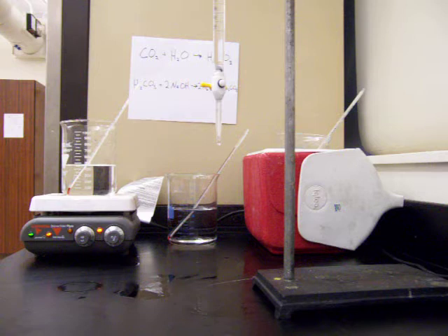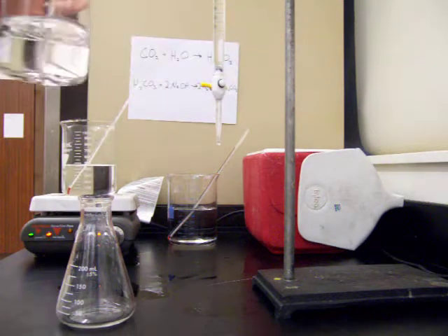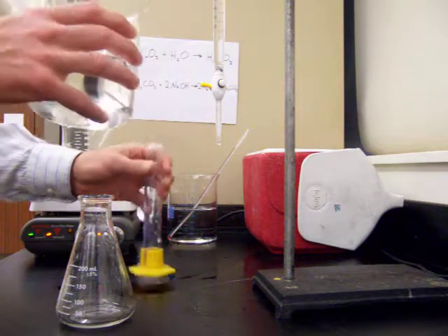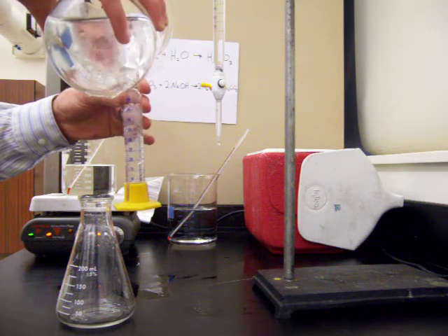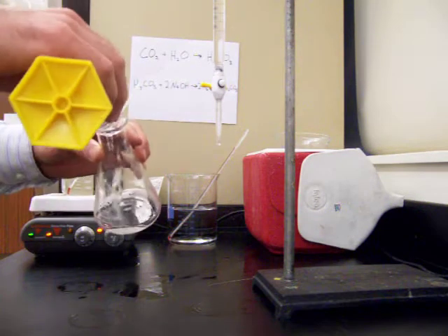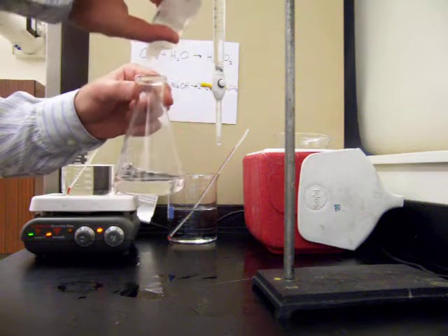You take the difference between 3.6, where it started, and 12.1, where we finished, to find how much sodium hydroxide was used during the first titration. That was the room temperature water. We'll repeat this with the cold solution, which has been kept on ice at about 5 degrees Celsius. Again we measure out a 50 milliliter sample of cold carbonated water and pour it into our Erlenmeyer flask with a couple drops of phenolphthalein indicator.